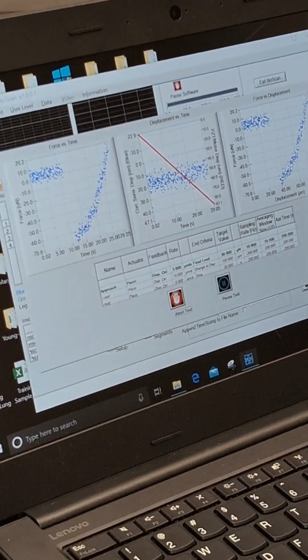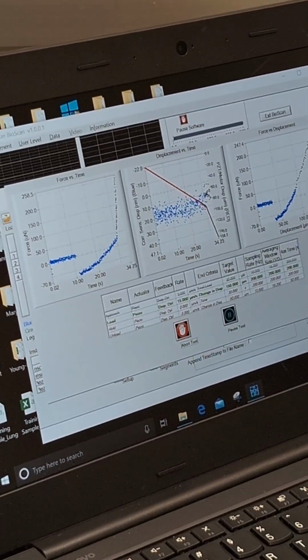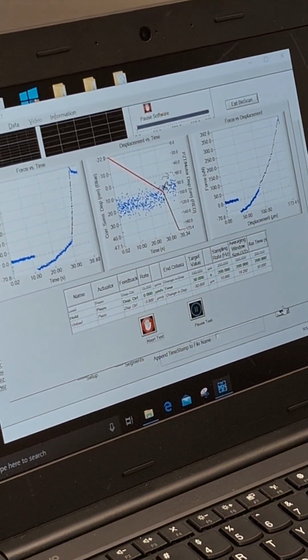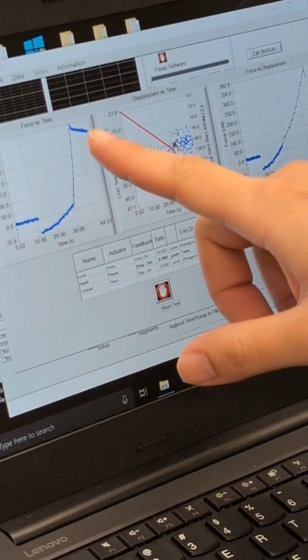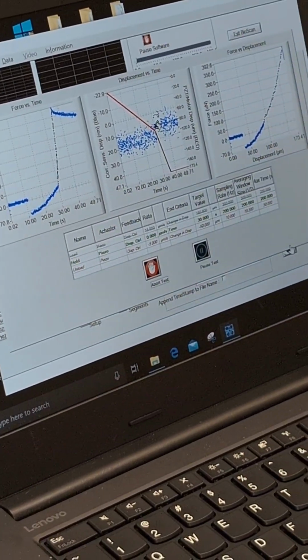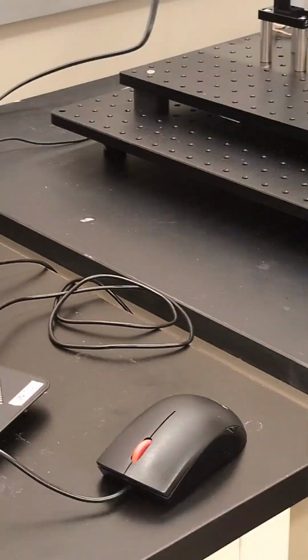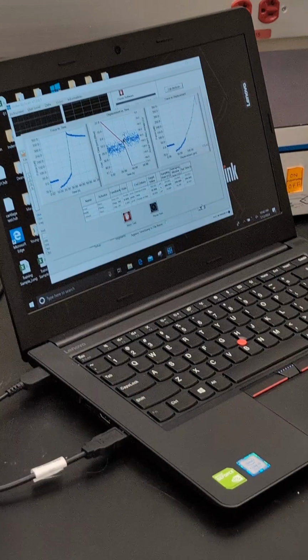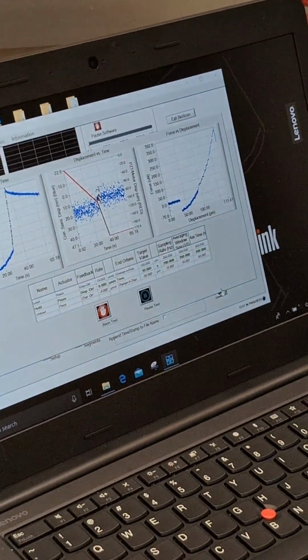Once you run the code on this, you will see how bad it is. You can see now, because I have the equation loaded, it was able to find the location of the indent, so it's still able to do the indentation and it will generate that curve, but this curve won't be as strong as the one that it had before. That's because a lot of the force that it's applying didn't even get caught by the hydrogel itself. So you are basically punching air, and the air doesn't conserve the energy you want to record.